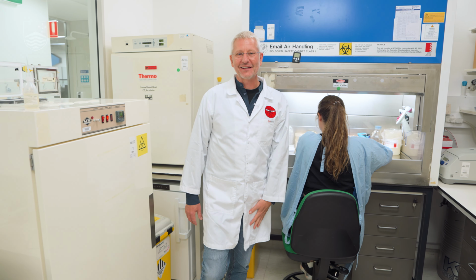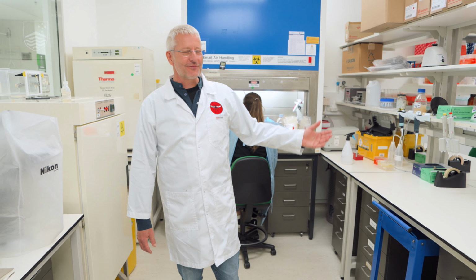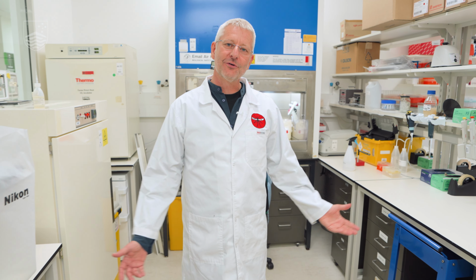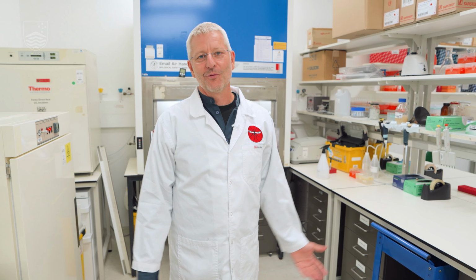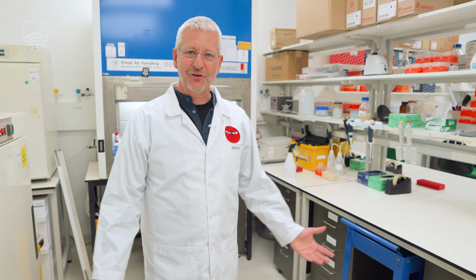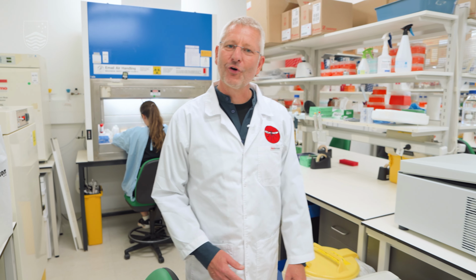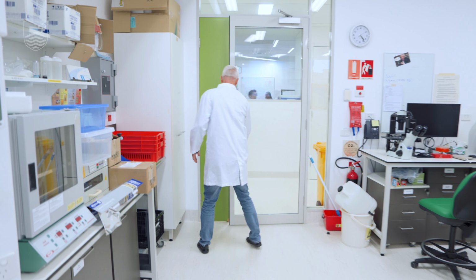So that was a solid day in the lab, and we have shown you quite a few parasites, and hopefully you have a bit of an impression of what it is like to work as a parasitologist on a day-to-day basis. To conclude the day, let's go out and meet the team again, but before that, we have to wash our hands.